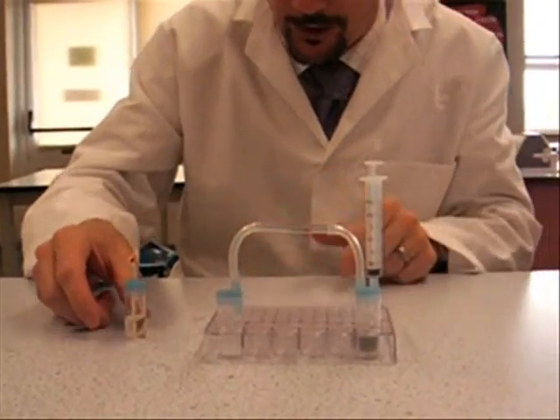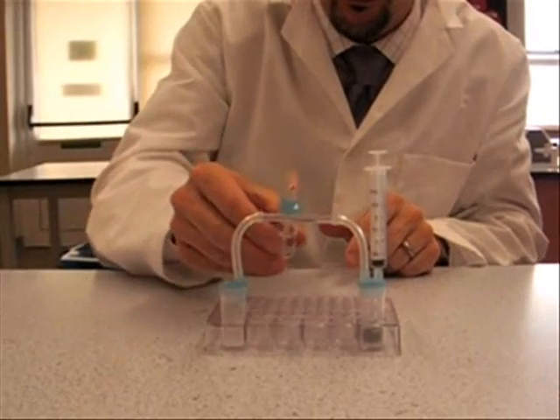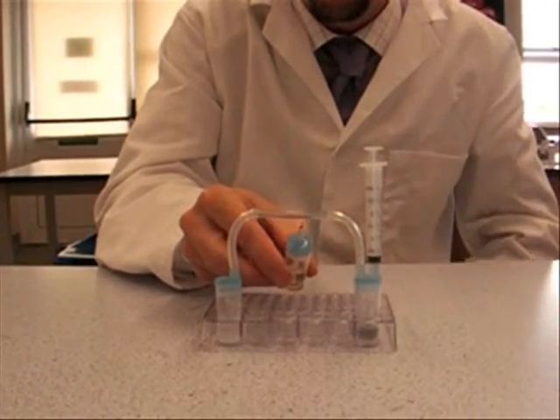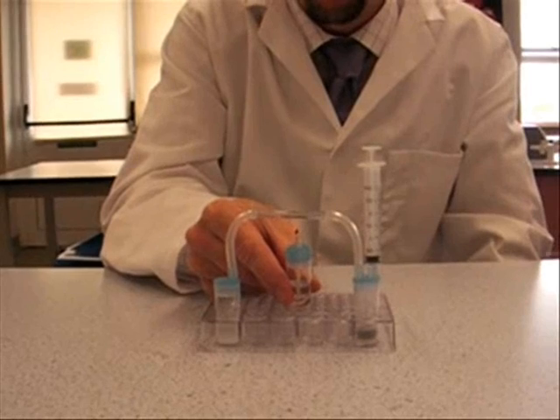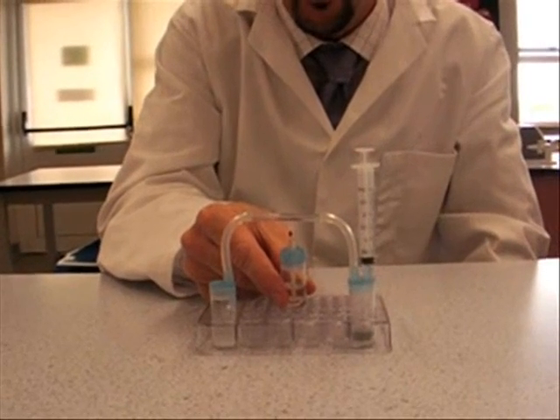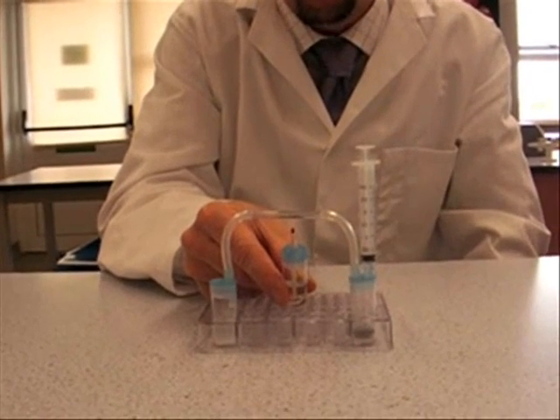Just like that did. So you can see you've got bubbles coming here. Ignore the first few bubbles. And then the idea is that you hold the spirit burner in one place underneath the copper oxide and watch what happens.